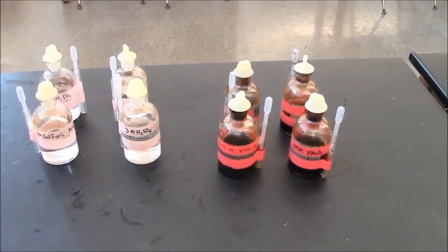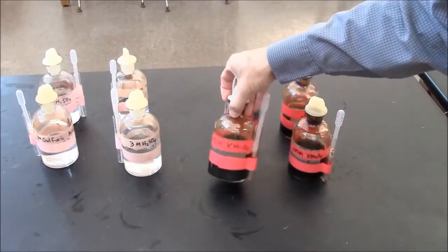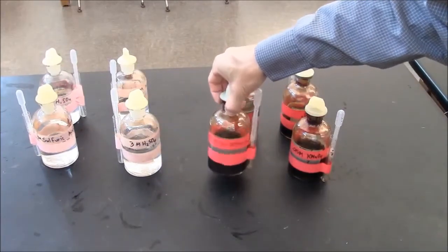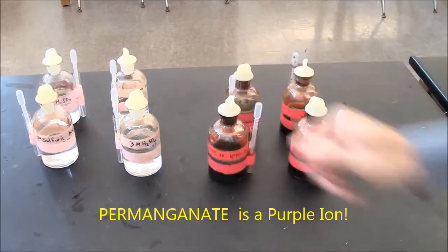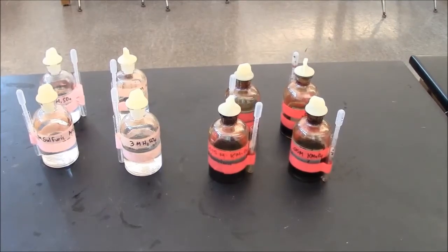The buffet table provides sulfuric acid and potassium permanganate solution. The permanganate is a dark purple color. It looks a bit like pomegranate juice, so that's a way of remembering the name. Permanganate looks like pomegranate juice.